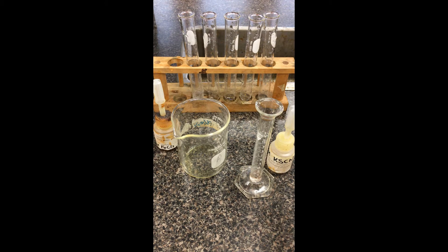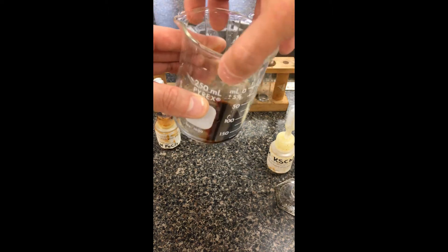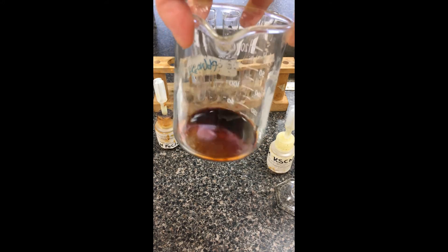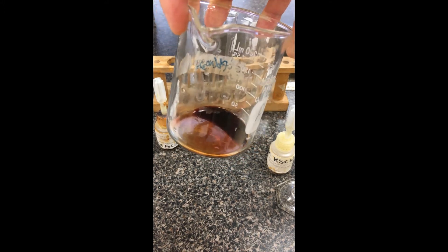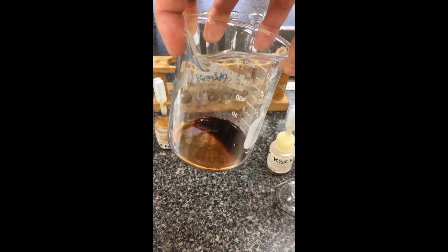What I'm going to do is dissolve it with water. We have our iron(III) chloride and our KSCN — just going to mix these. You can see it's very different in color. You can look at the equilibrium on the chart to figure out what formed, but definitely a much more deep reddish color.